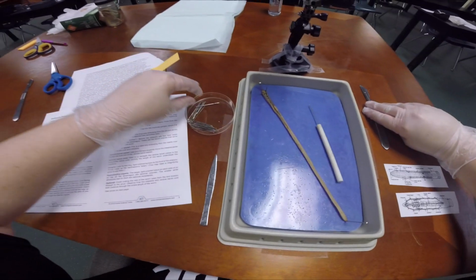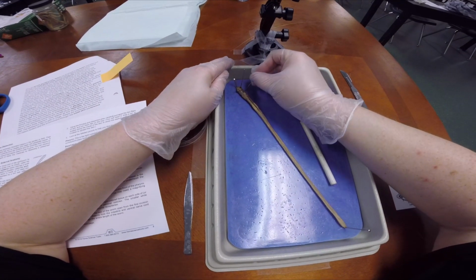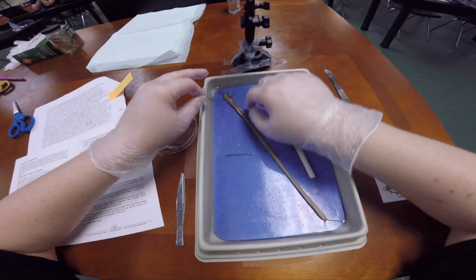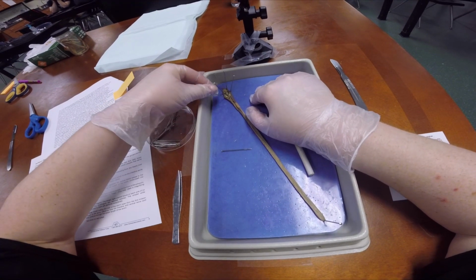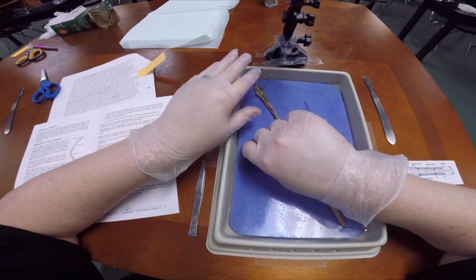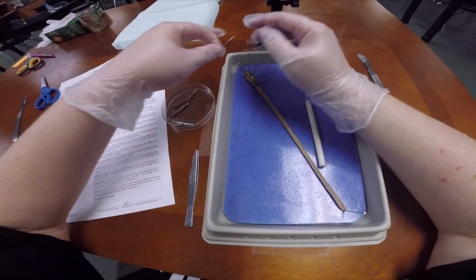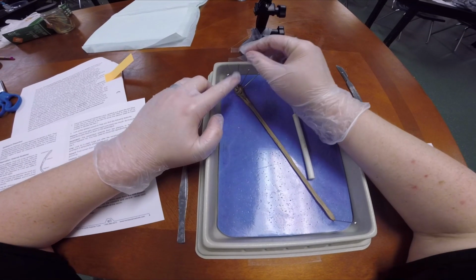There we go. Okay, so we're going to take another pin, and we're going to pin that one. Remember, you want to pin at an angle so you can actually see the inside and you can see what you're dealing with. Alright, so you'll notice when we open them up, there's a lot of things that are the same color because earthworms are not super, super complex organisms, but they still have a lot of detail going on.